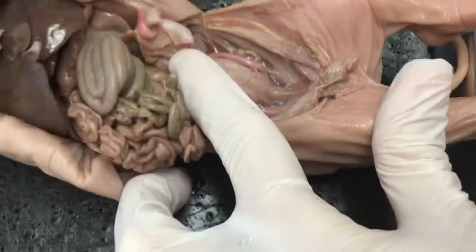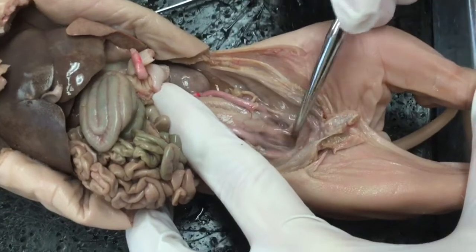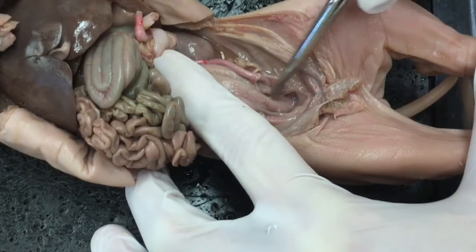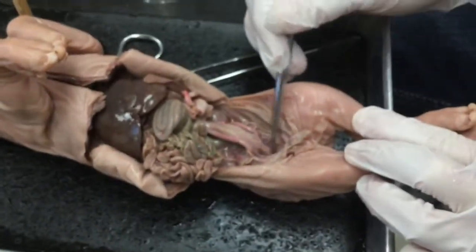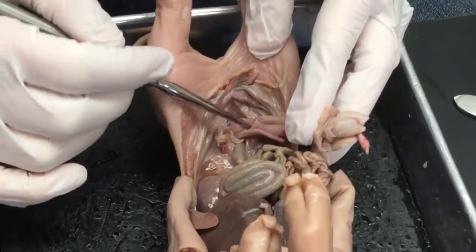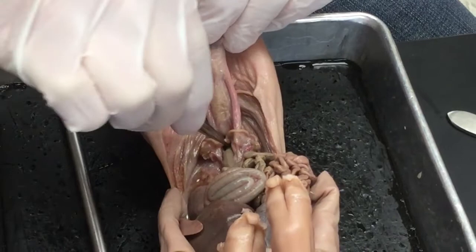So right now what I can see pretty clearly is from the bladder we can see that there's a continuation of tubules. That opening is where the urine will exit. So the urine's leaving the urinary bladder through the urethra. Okay, ladies, where we left off before, we were just kind of opening up between these two, and we had identified this as our bladder. We had indicated that this is our uterus.